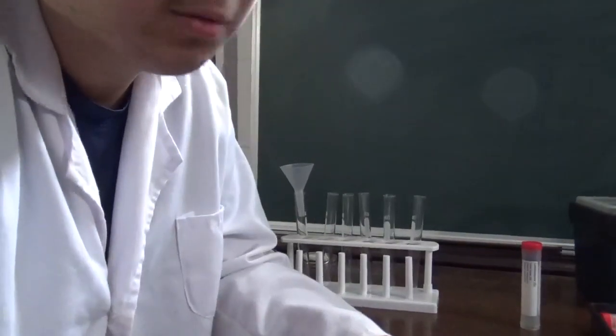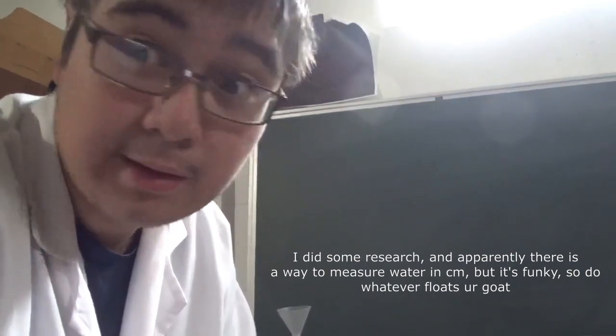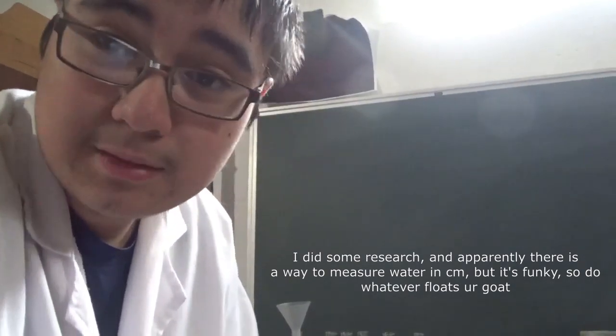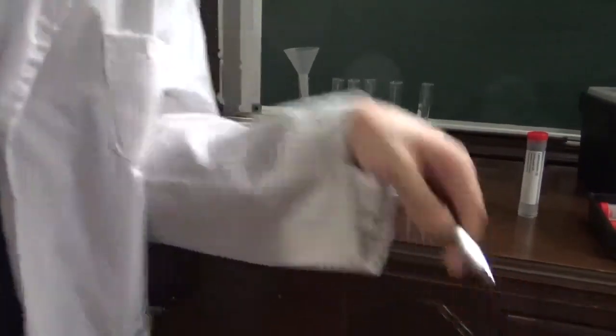I'm thinking, what do you mean three? Do you mean three cubic centimeters? I don't know what they were thinking, but obviously you don't measure your liquids in centimeters. Okay, that's just wrong. That's just wrong morally. You should be ashamed of yourself.